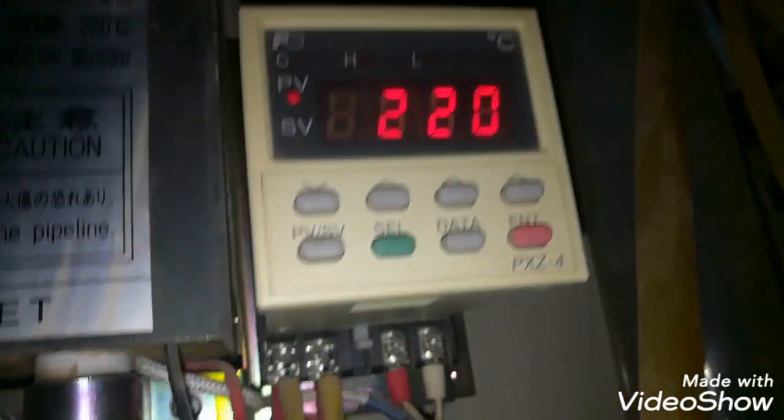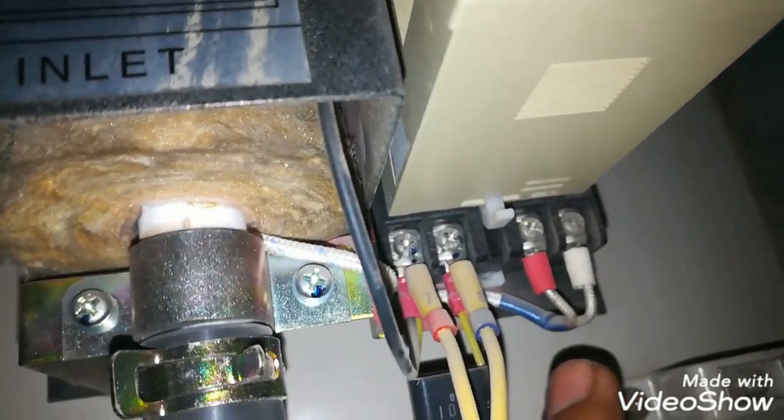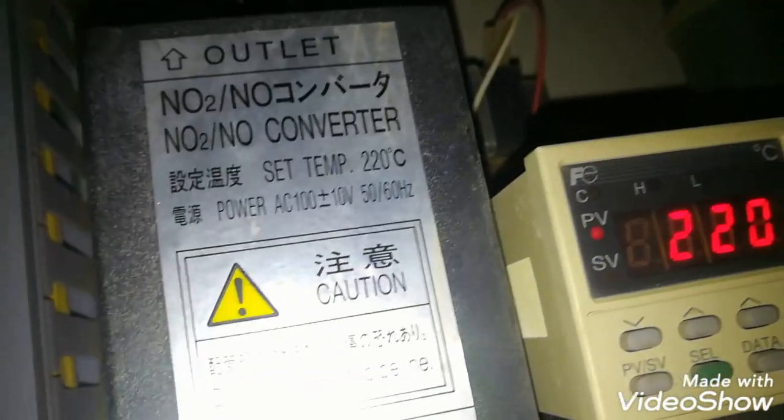We have set the set point to 220 degrees. This is the AC supply for this controller. When the temperature does not match the set point, it will turn the heater on and off to keep the temperature at the set point of 220 degrees centigrade. Here is the cabling going to the heater through the controller contact. The heater supply is 110 volts.